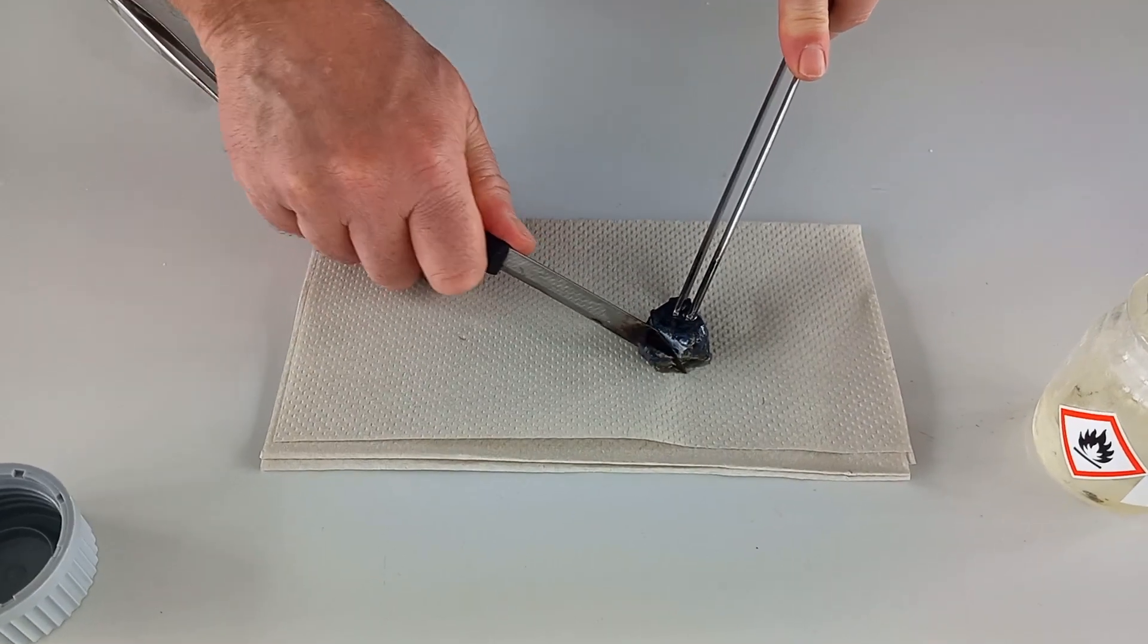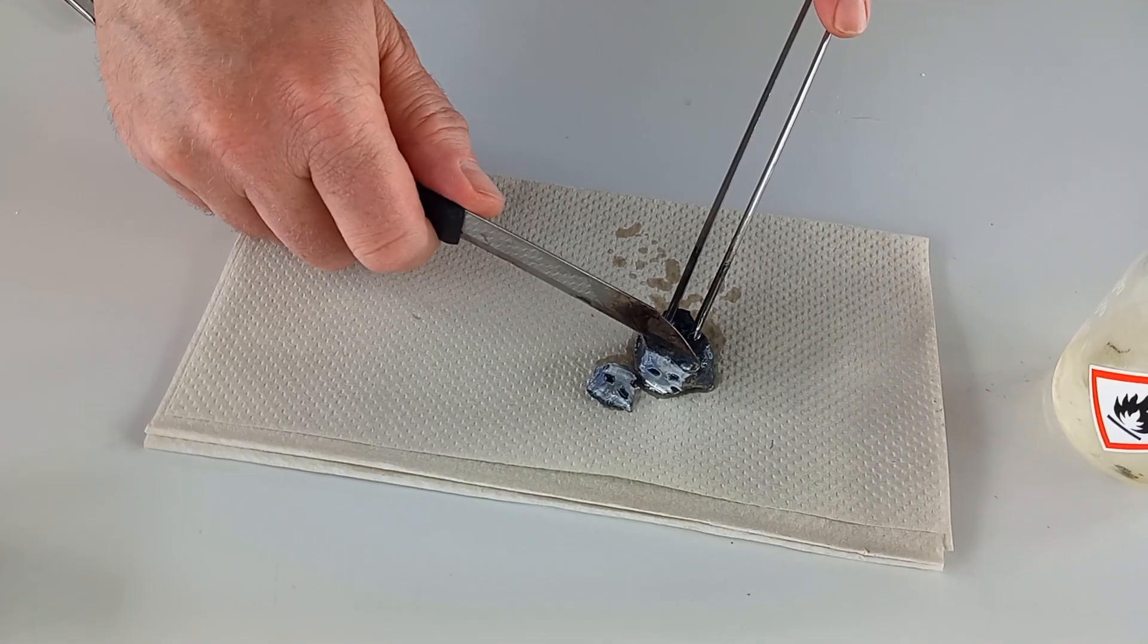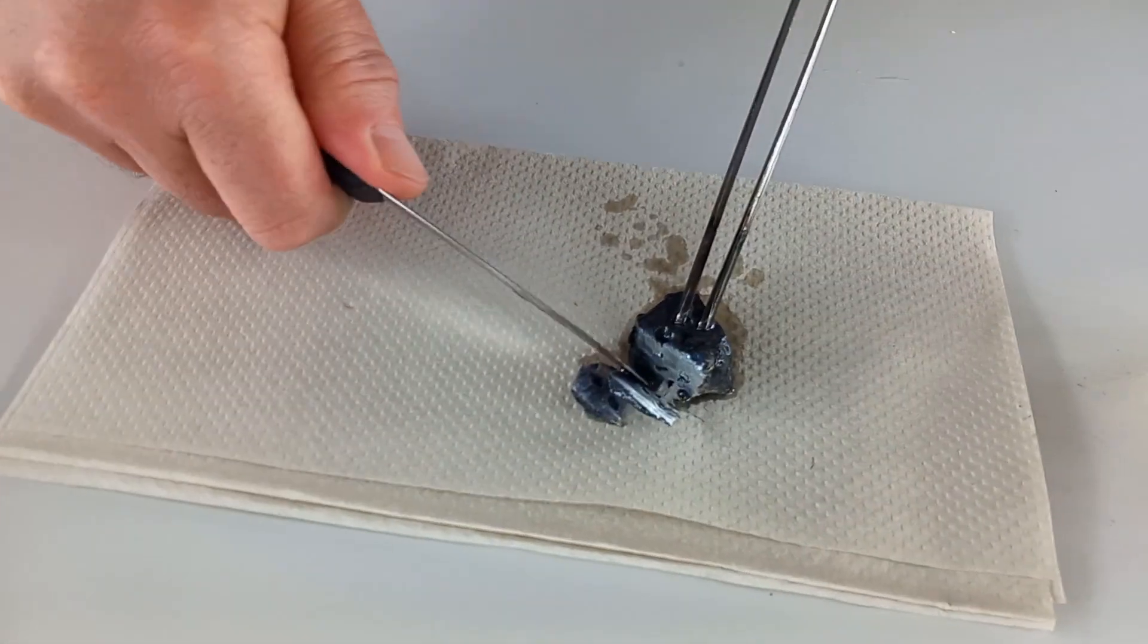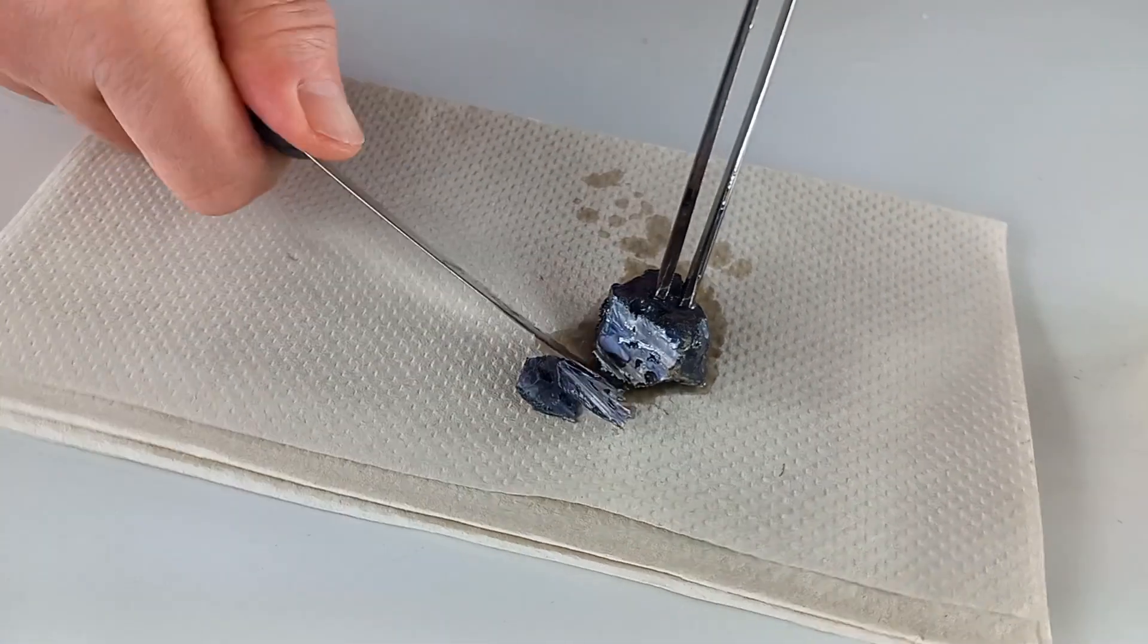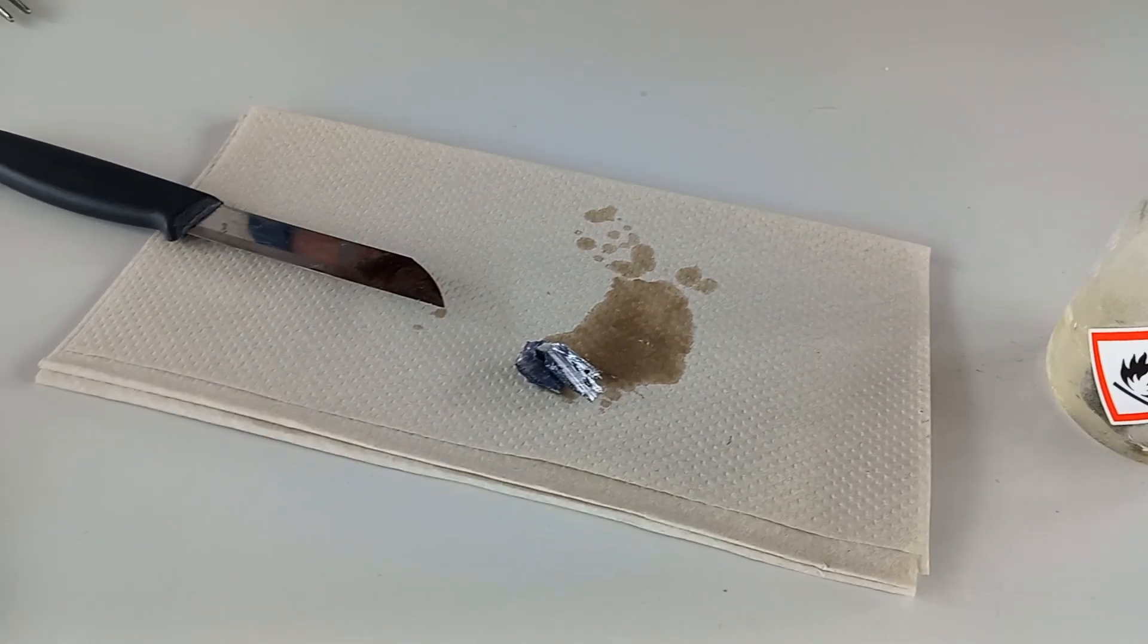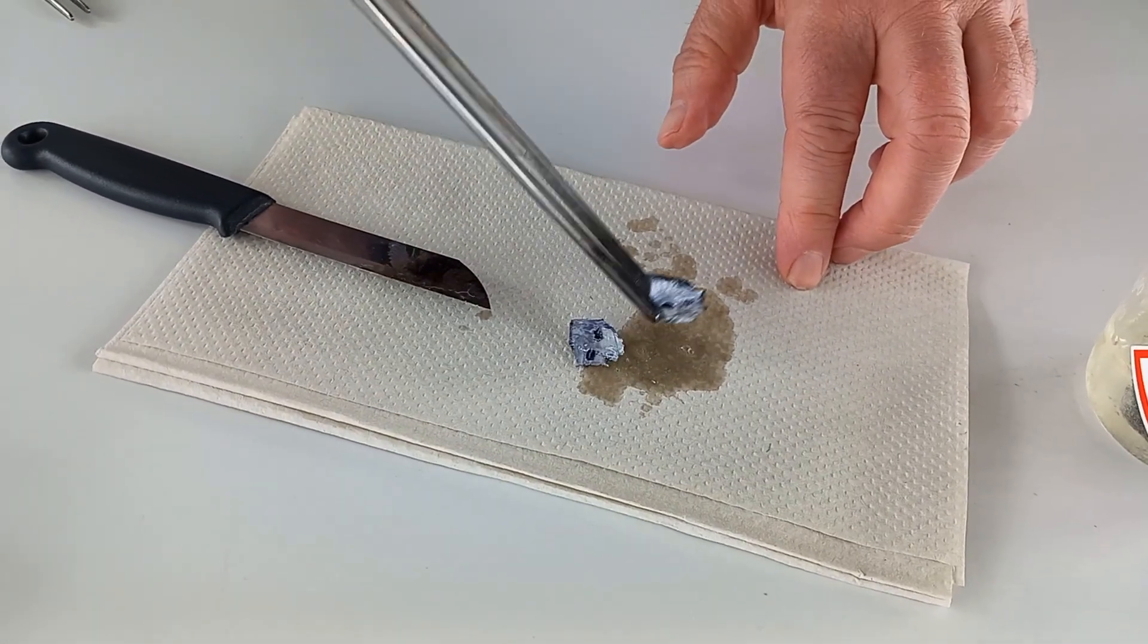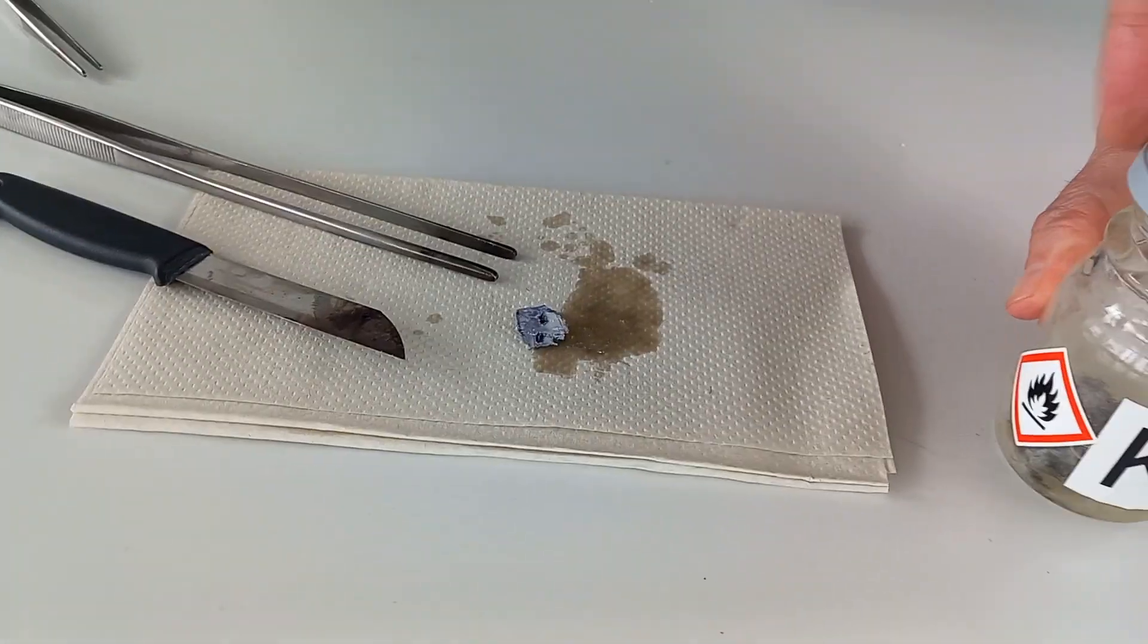And like the other two metals, it is oxidized on the outside and shiny on the inside. For safety reasons, we raised the glass shield.